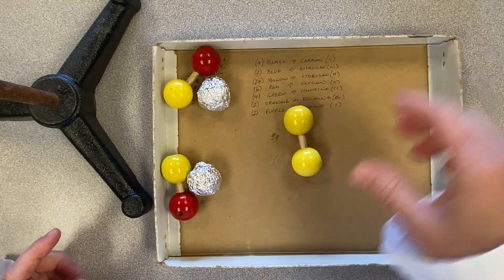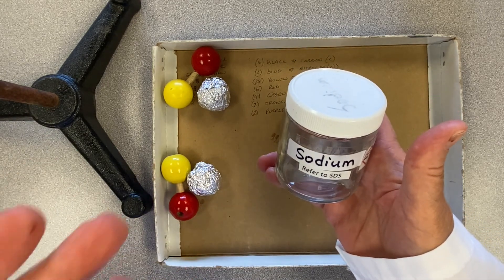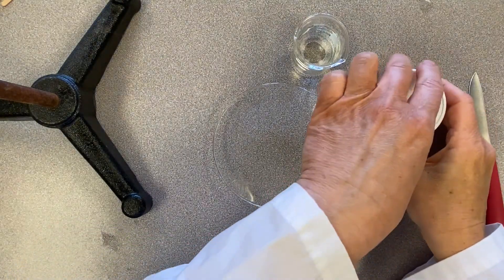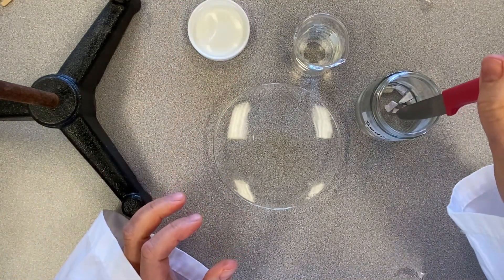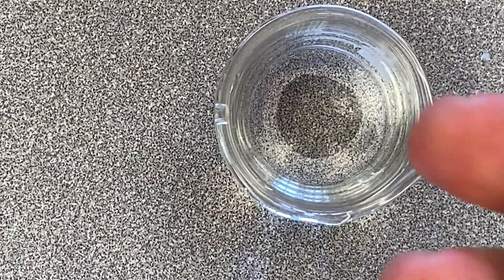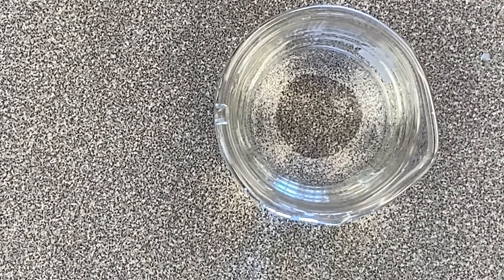So when I put the sodium in the water, the hydrogen gas that is released at the surface of the water — as it escapes — I should be able to light that on fire. The sodium is stored in oil because in water it behaves very differently.